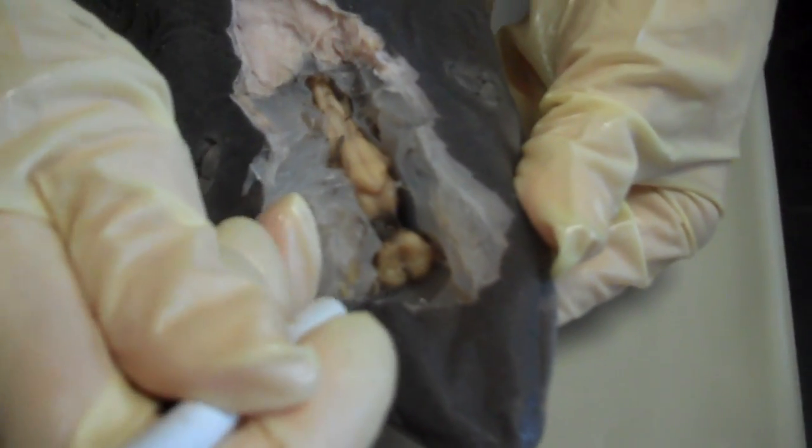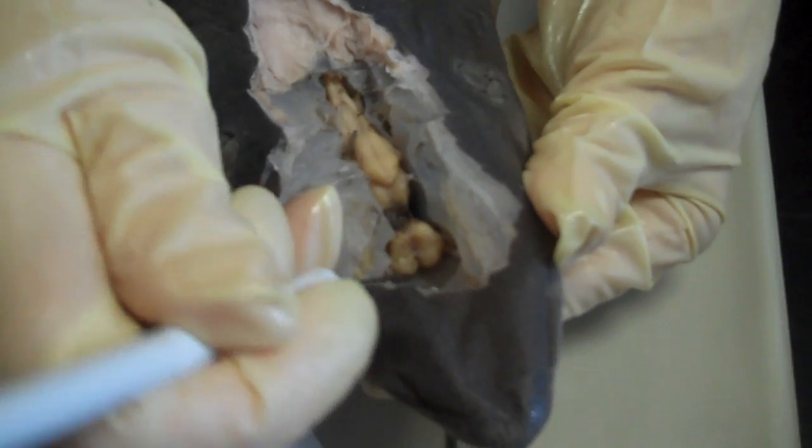Nervous side. Look at the female. Oh, here I can do the brain on this one. This is pretty good. Most anterior, these two bulges that you see here are the olfactory lobes for smell.